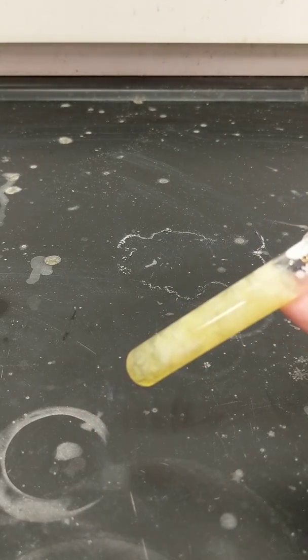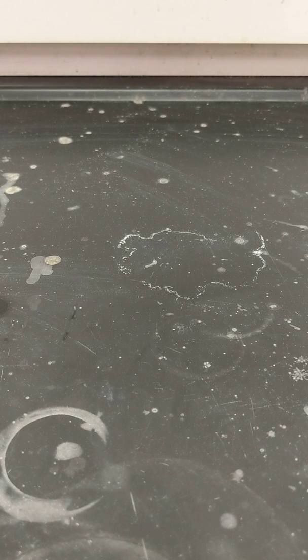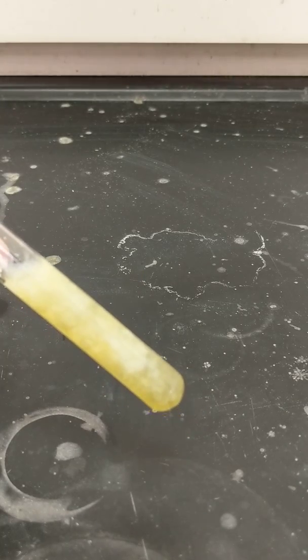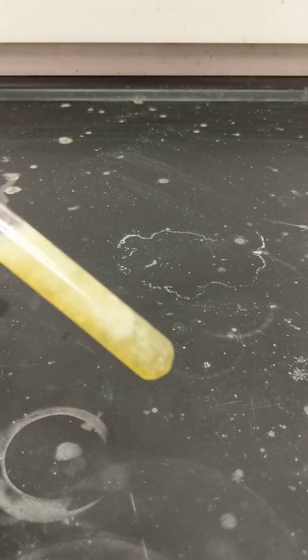Reaction 5 has become cloudy and yellow. Reaction 6 has become cloudy and yellow.